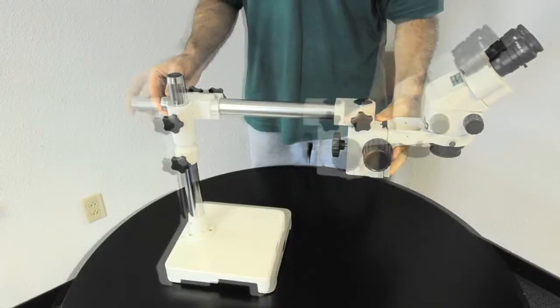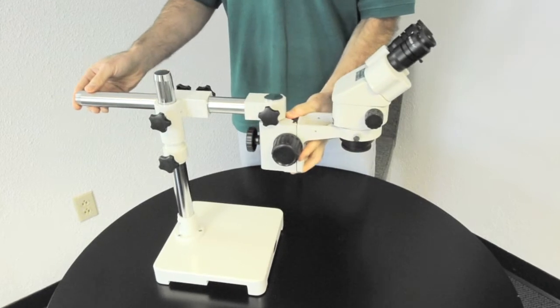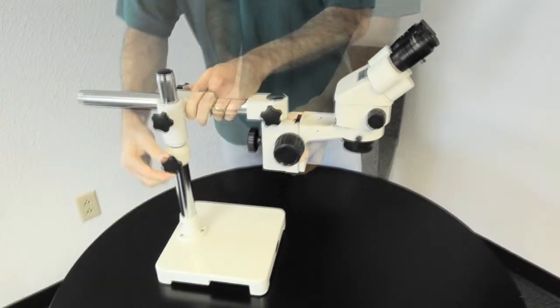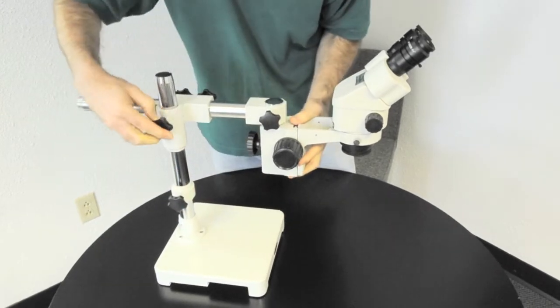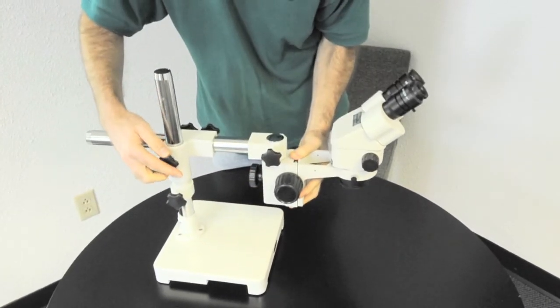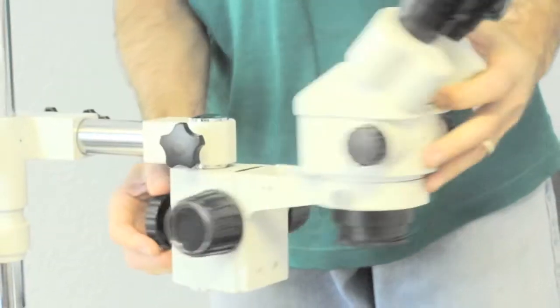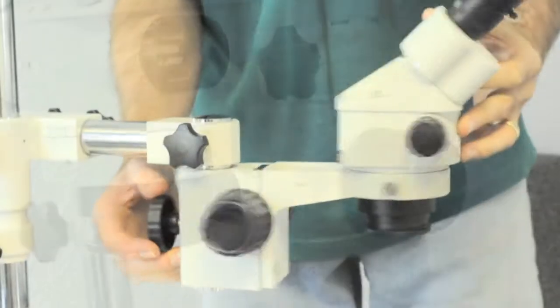There are a number of adjustments available which gives the system great versatility and allows it to be positioned for maximum comfort. The focus block can be swiveled on the end of the arm and features large coaxial knobs for the primary focus control.